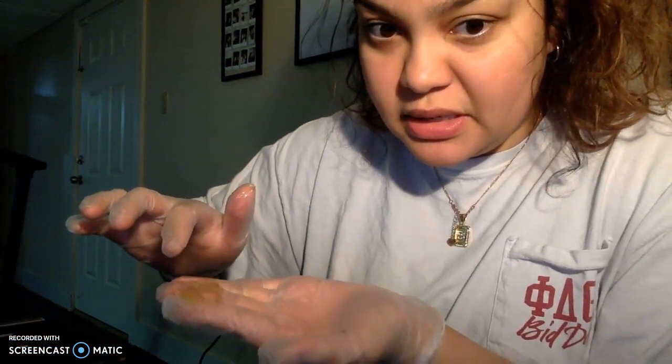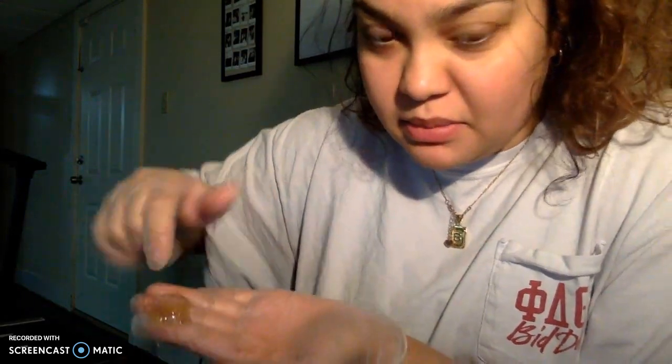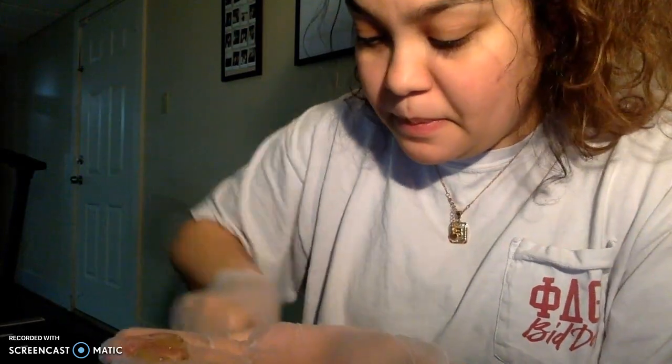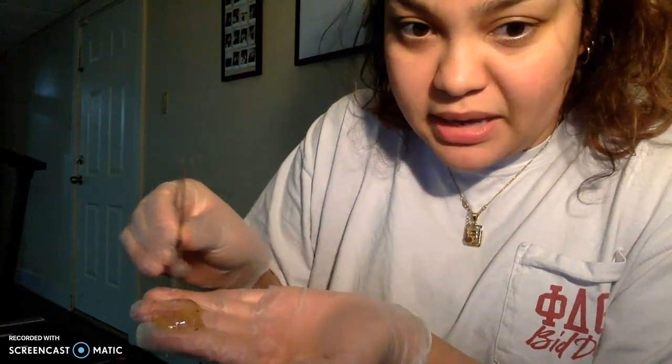As you can see, it's clear, and then right there in the middle is the pupil, right here. And like I said, those black things are my rubber mat from my dissection. I sliced too hard. I sliced into it and it got on some of my things.